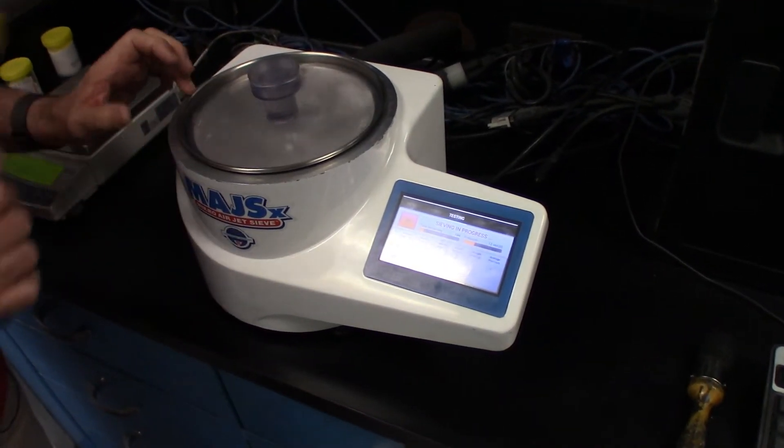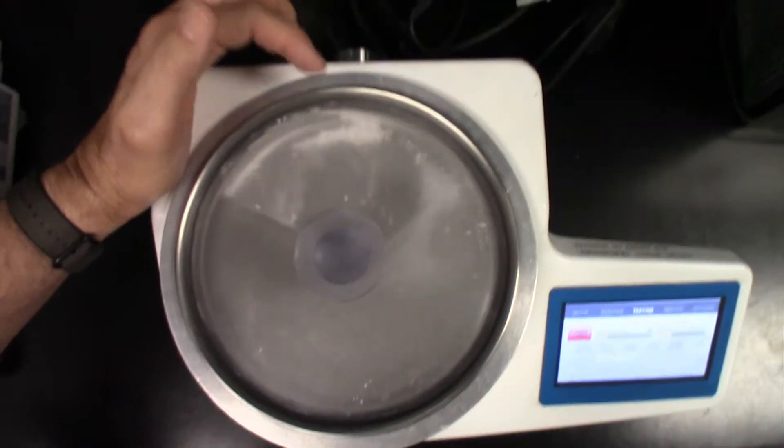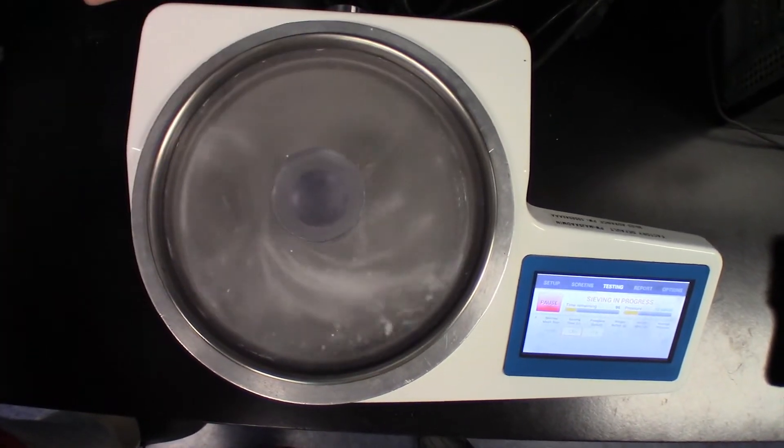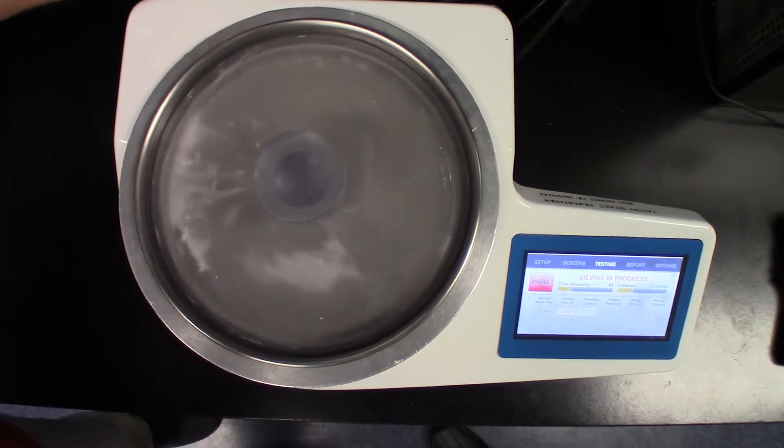The method that we're using is the pneumatic sieving principle, or aerodynamic sieving. As you can see, the particles are racing around the surface of the screen. Particles that are fine enough to pass through the screen, they pass through the screen.